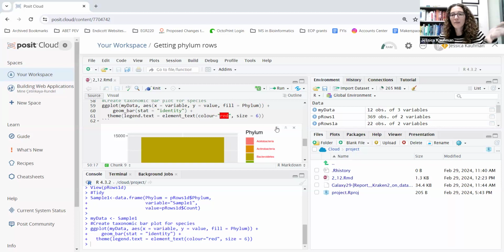And it's not surprising, but firmicutes and Bacteroidetes, those are the ones that we're going to write a report on later this week or make a table later this week. Those are the highest abundance of all the phylum. So totally normal results for a microbiome project.